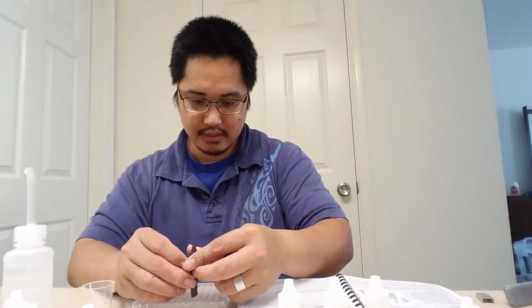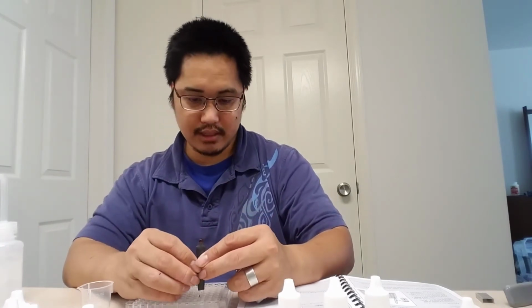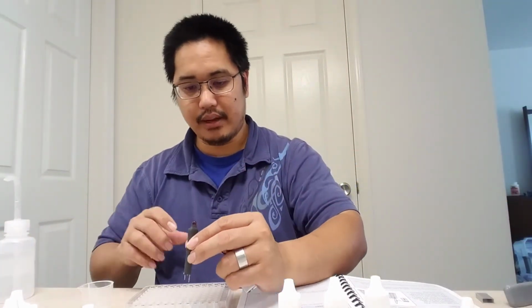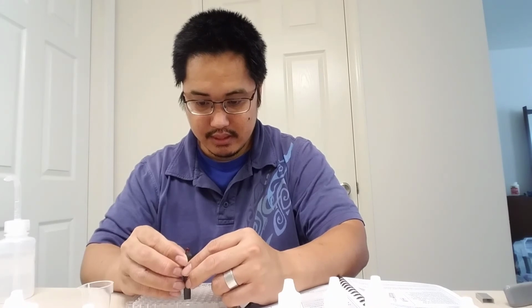I'm not going to tell you which one this is. You can take pictures if you want to try to compare the brightness one to another. Here's another one. You can barely see that. And then here's another one. And keep in mind, I forgot to include the sugar water, so that should be in one of those. Oh, that's interesting. That's really interesting. I'm not going to tell you which one that is, because I want you to conduct the experiment yourself.